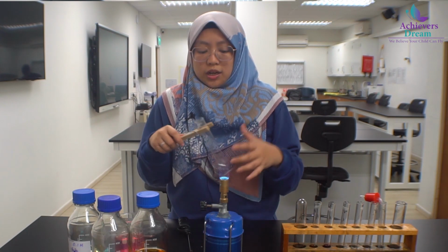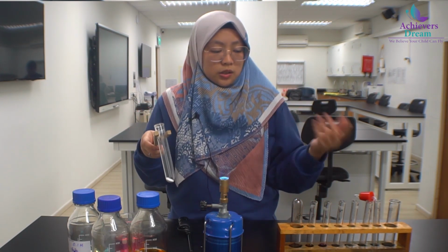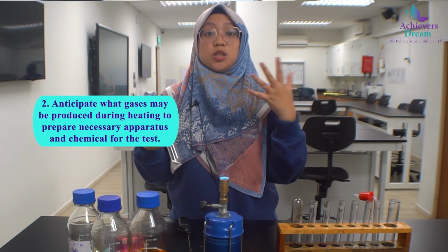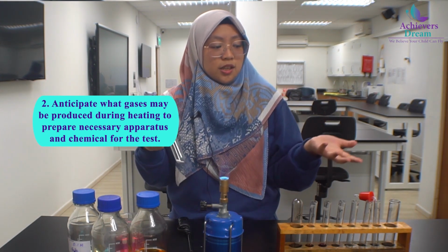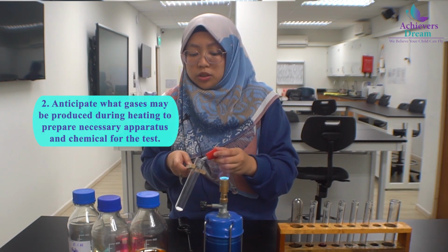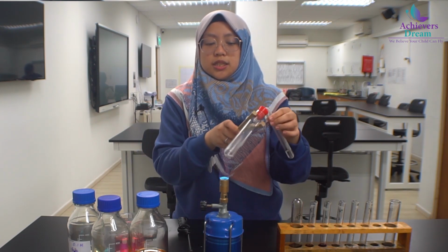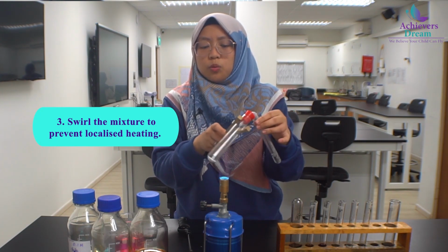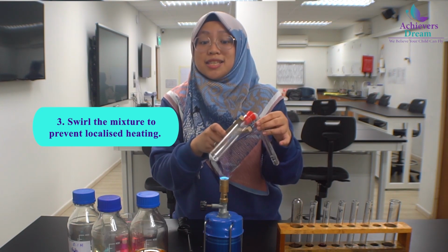Alright, so when you have already taken note of the appearance before heating, you also need to anticipate what gases could be formed during the reaction, during heating, so that you can prepare the necessary materials. So in this case, I prepared lime water because it could be a carbonate. Now that we heat the sample, make sure to swirl the boiling tube or move it from left to right to avoid localized heating.